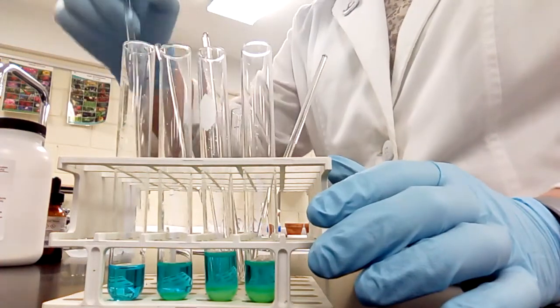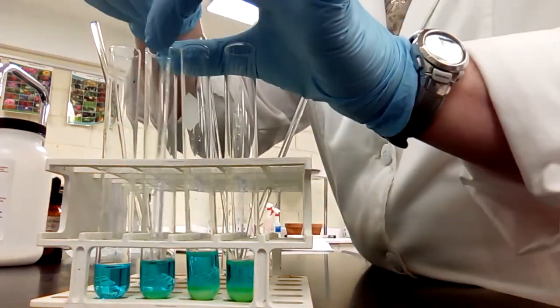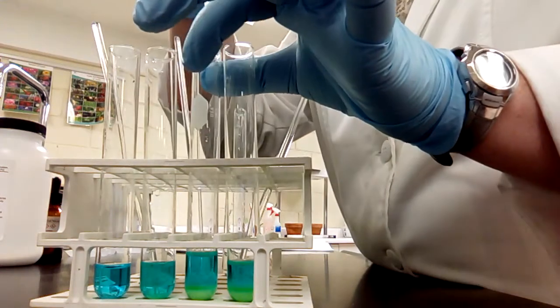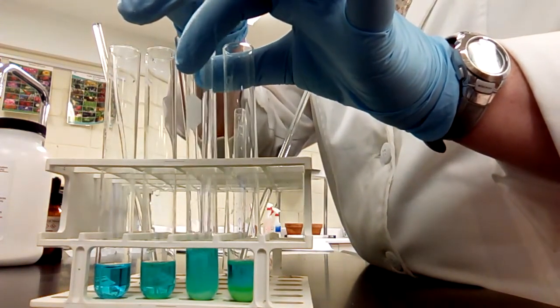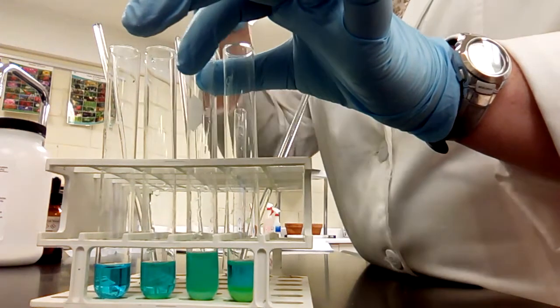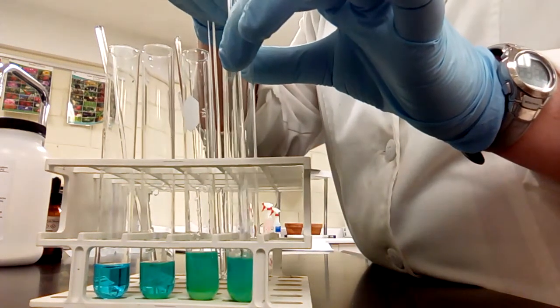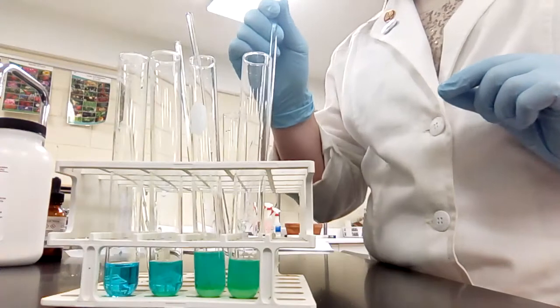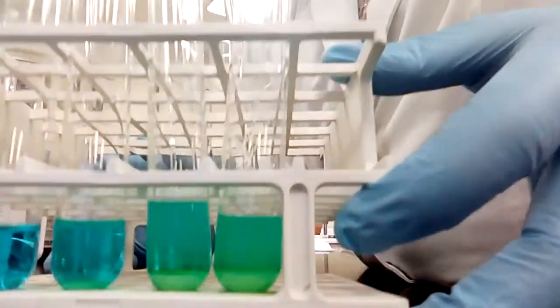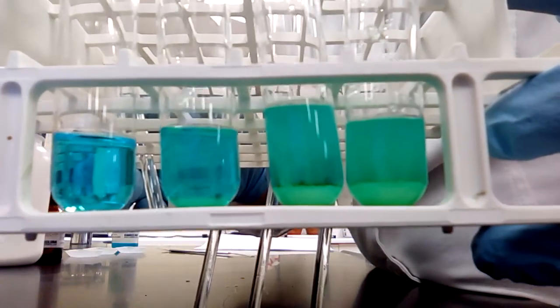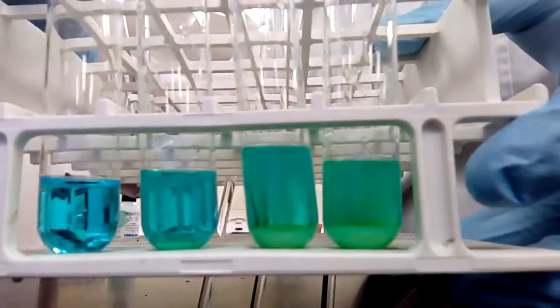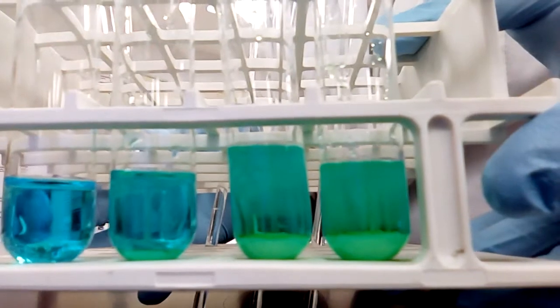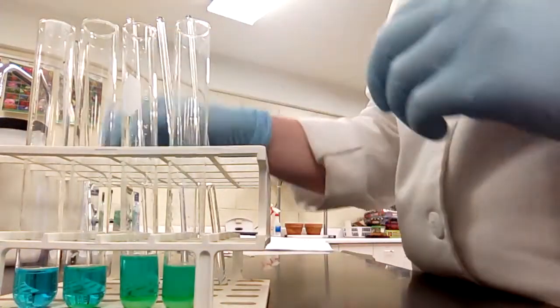Here's my control. Here's my first one. Mix that up a little bit. And 0.6. And 0.9. Colors are always a little bit difficult with a camera, but I can definitely see a color difference. And not all that salt has even dissolved yet. But this one is definitely more blue, and these are definitely more green. They're almost like a green-yellow kind of color. And we can let that salt dissolve just a little bit more.